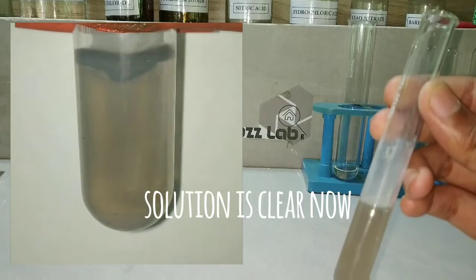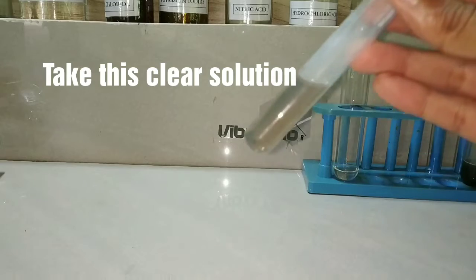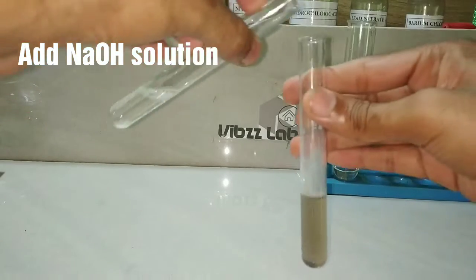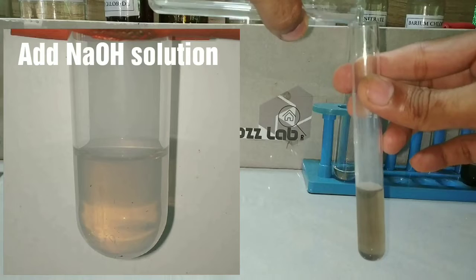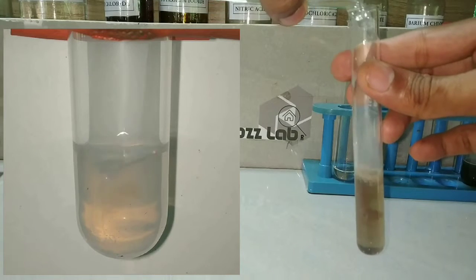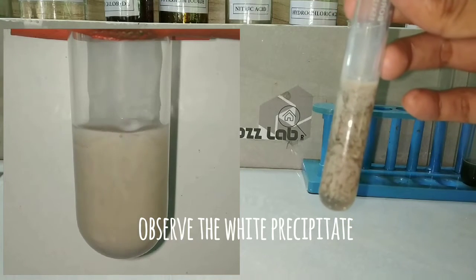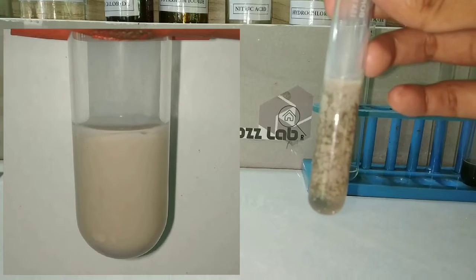Now we take this clear solution and add sodium hydroxide into it. On adding the sodium hydroxide, there is formation of a white precipitate.